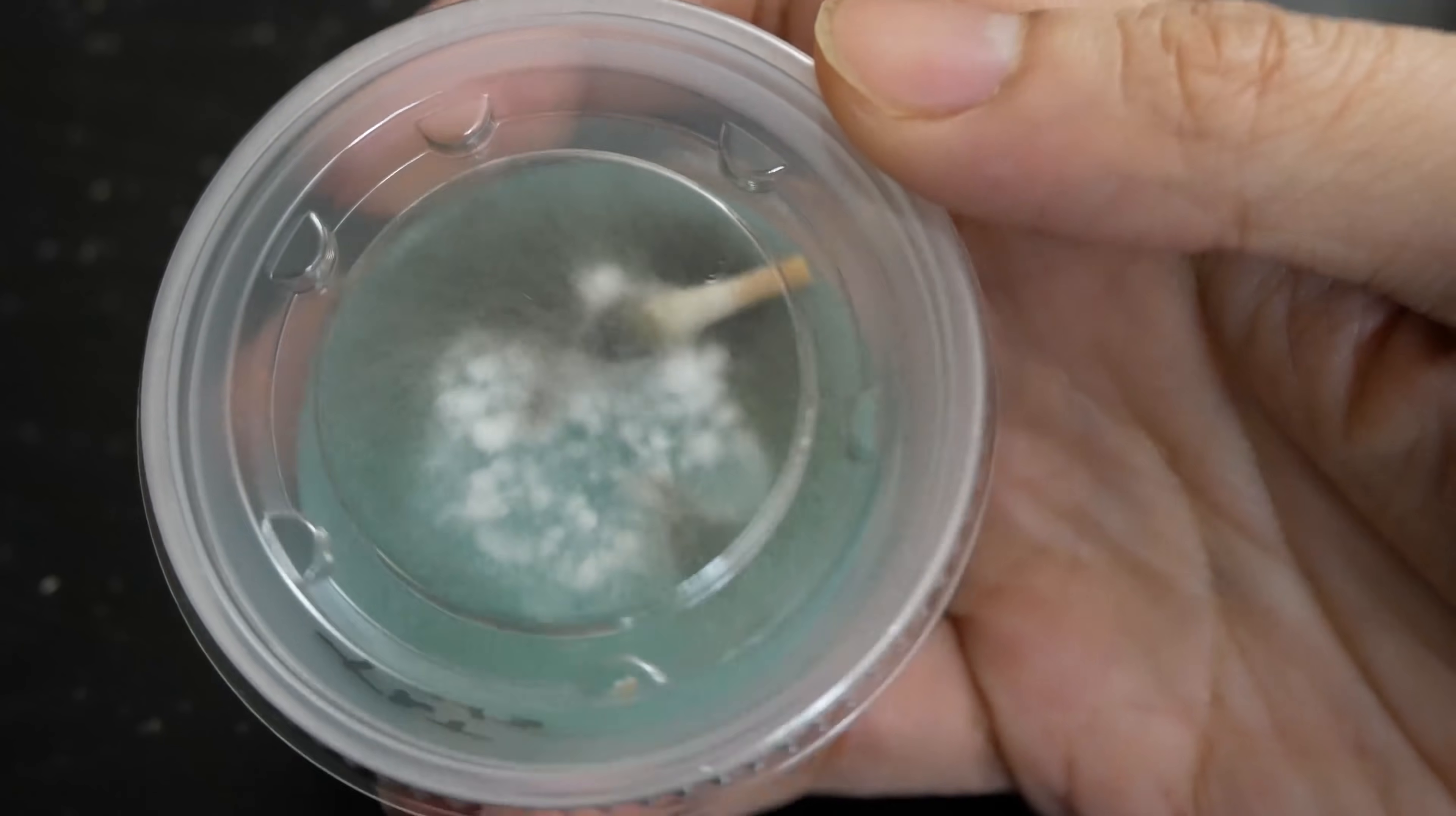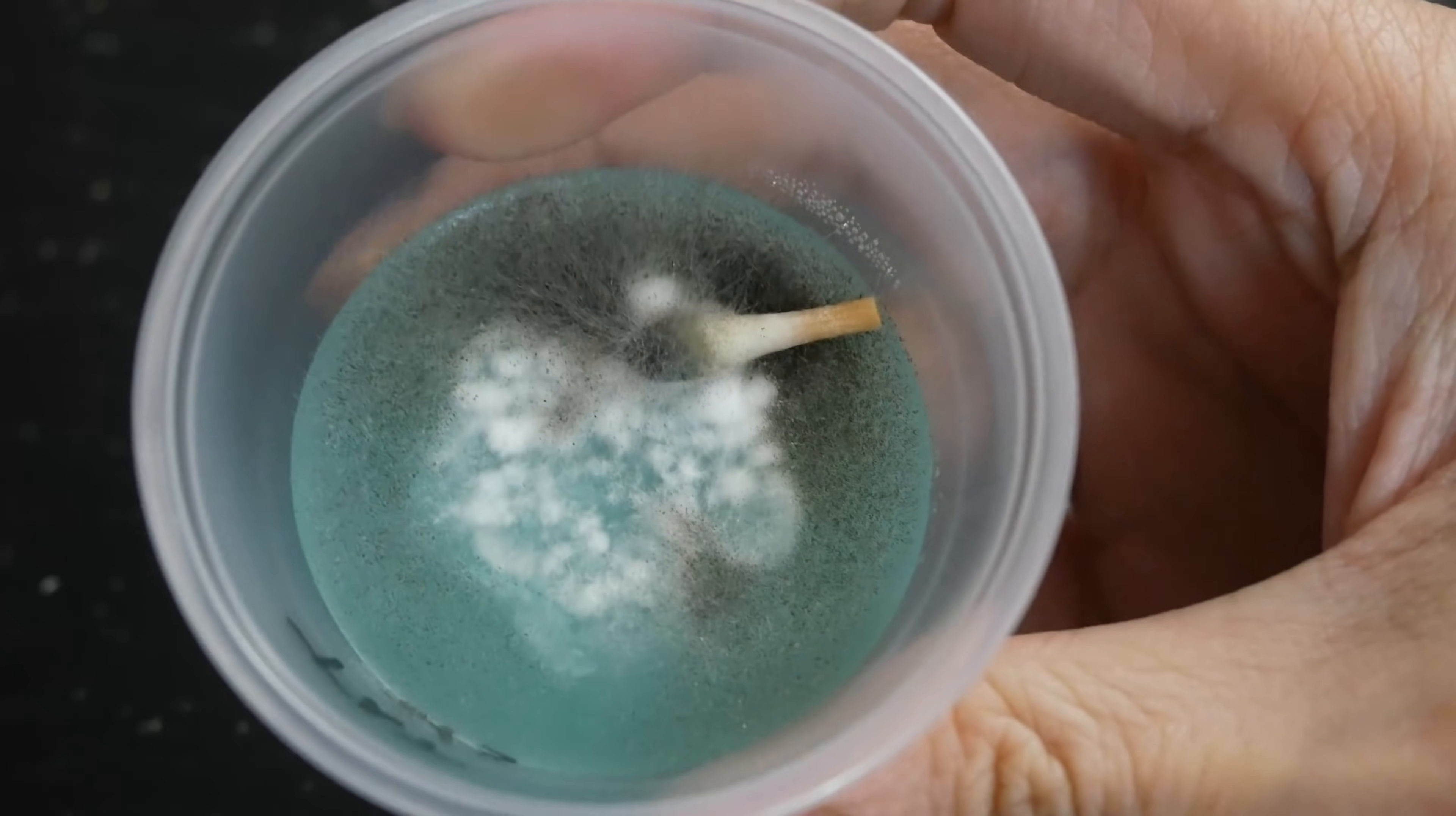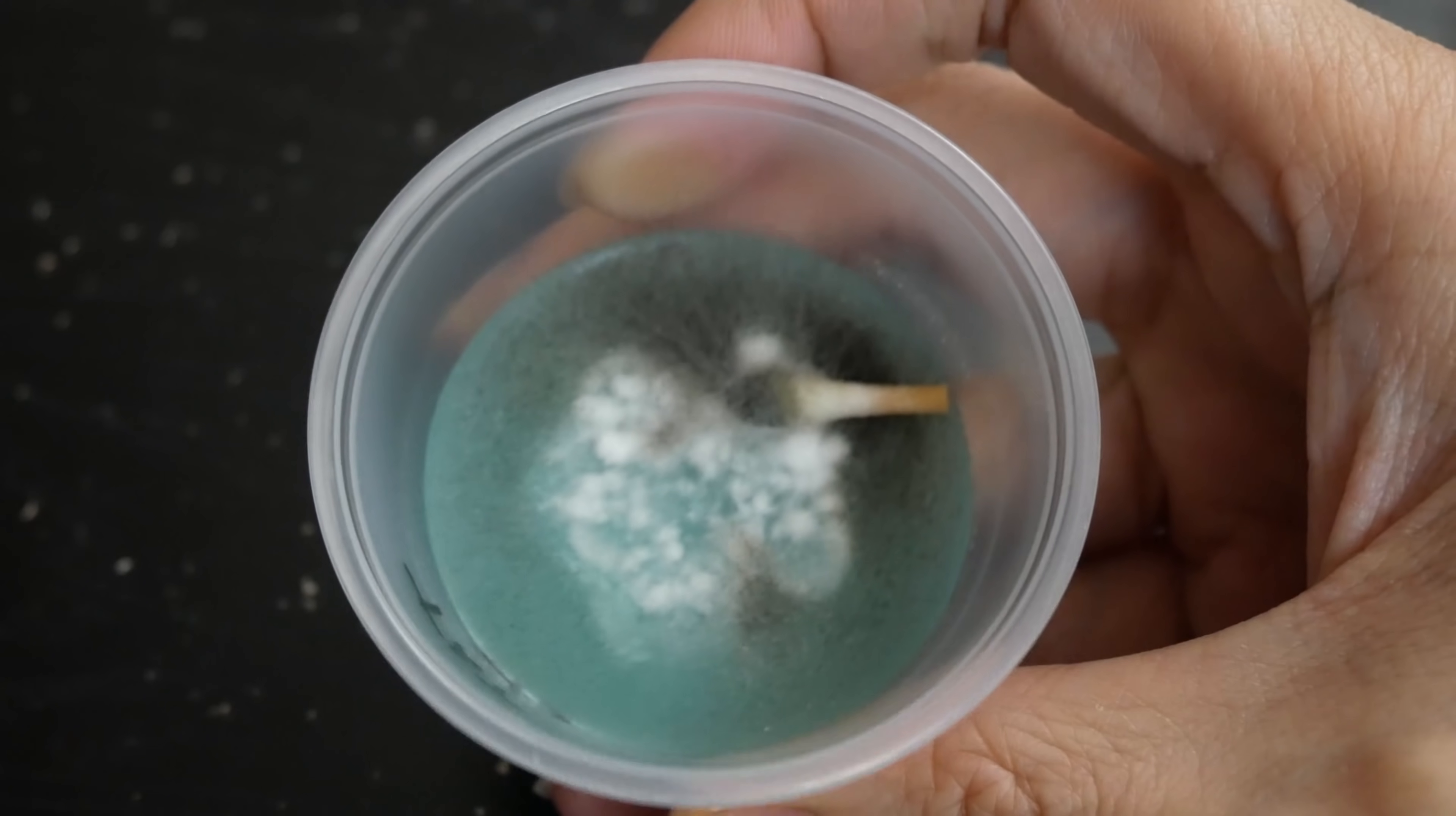Always assume that spores are going to be dirty when you're working with them. Here I'm going to open this up and give you guys a closer look at the abomination here. If I can get the camera to focus here, come on... there we go.